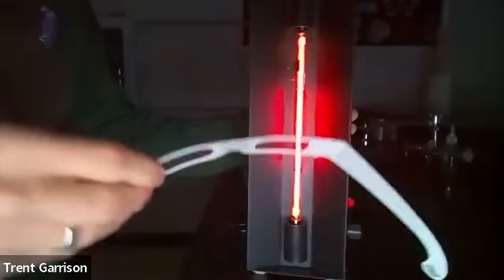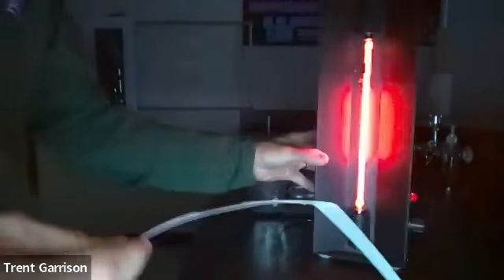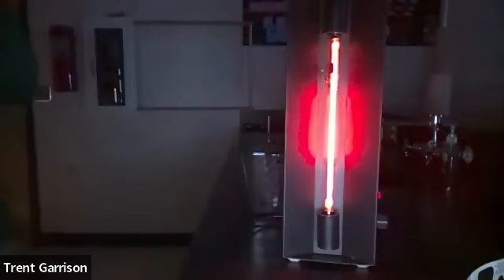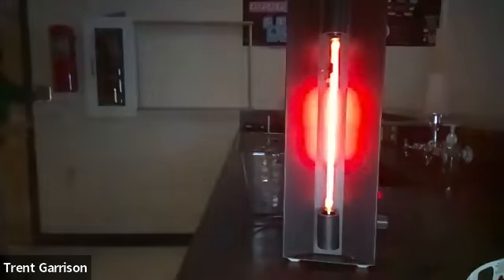That is the spectral analysis of neon. Neon is made up of what appears to be 3 different streaks of color. Those represent the electrons that are moving from the excited state to the ground state. So pretty cool in that regard that you can identify an element, even if you don't know what the color is, you can analyze its colors through that process right there.